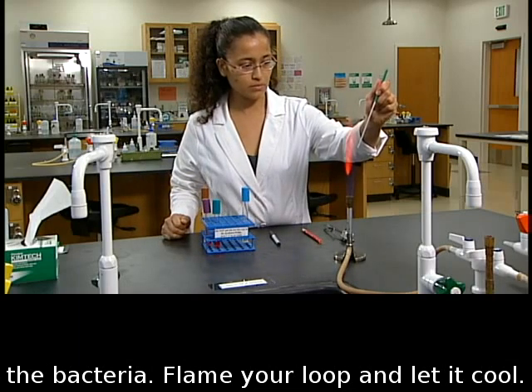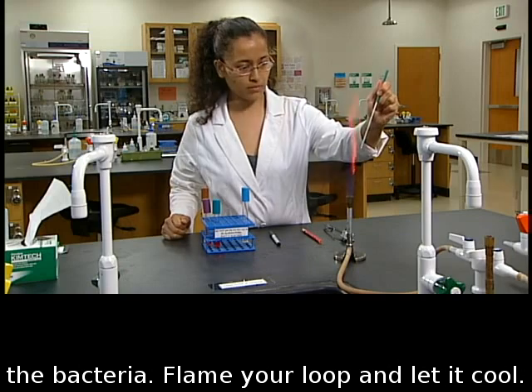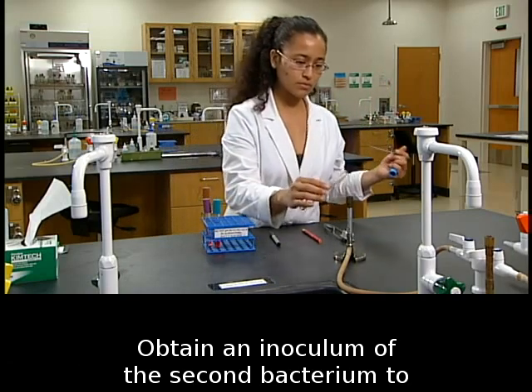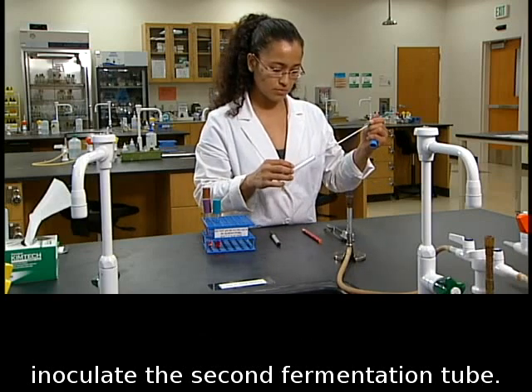Flame your loop and let it cool. Obtain an inoculum of the second bacterium to inoculate the second fermentation tube.